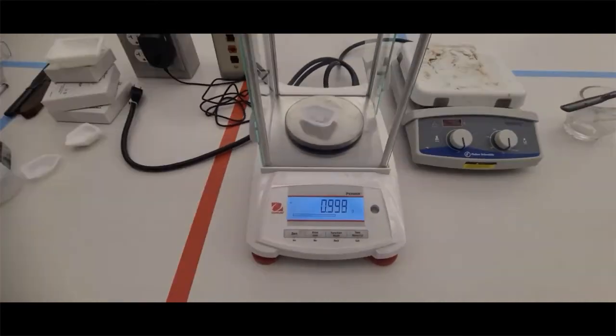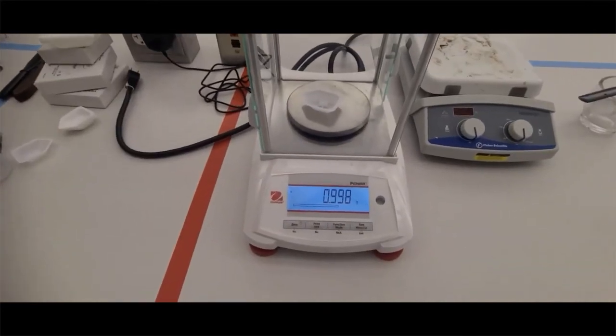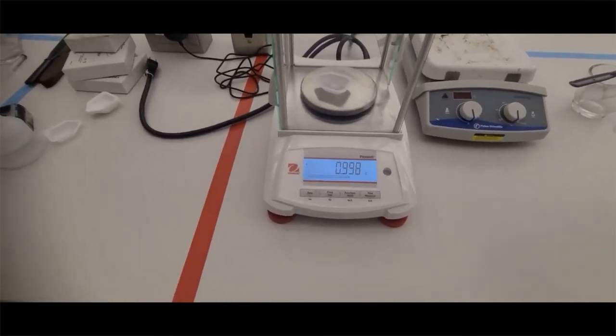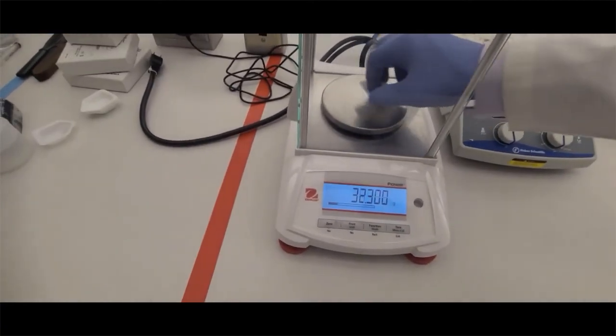But for us, we are going to do a quality assurance step on them. You are going to weigh them. And when you're done weighing them, you can dispense them appropriately in the container.